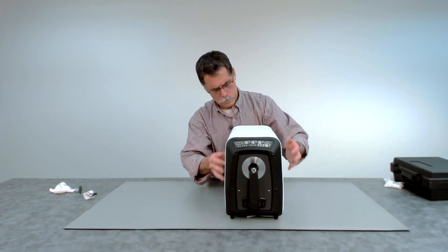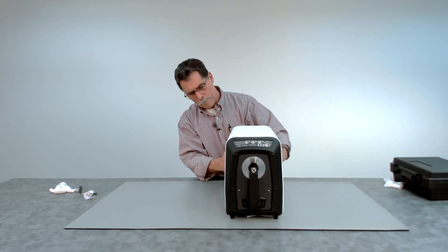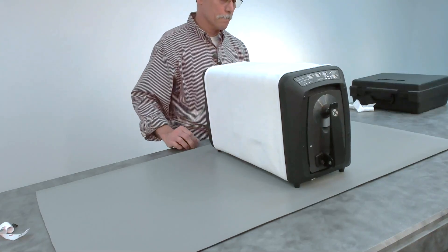And now the instrument is better protected from the environment.